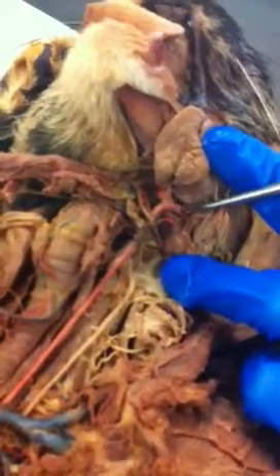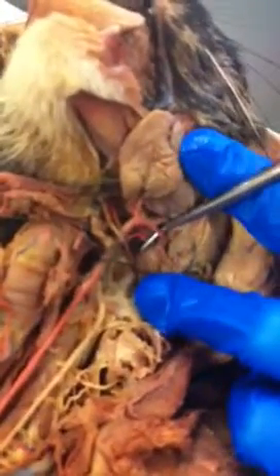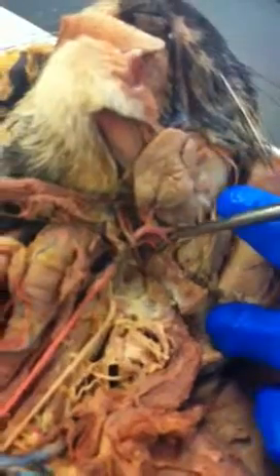Second branch off external carotid artery is external maxillary artery, supplies the mandibular salivary gland. External carotid continues and disappears, but before it does, its last branch is caudal auricular artery, which goes to supply the auricle of the ear and other structures. And then finally, you have the spinal accessory nerve, which is going to supply your sternomastoid, cleidomastoid muscles, which are here. Sternomastoid, cleidomastoid.